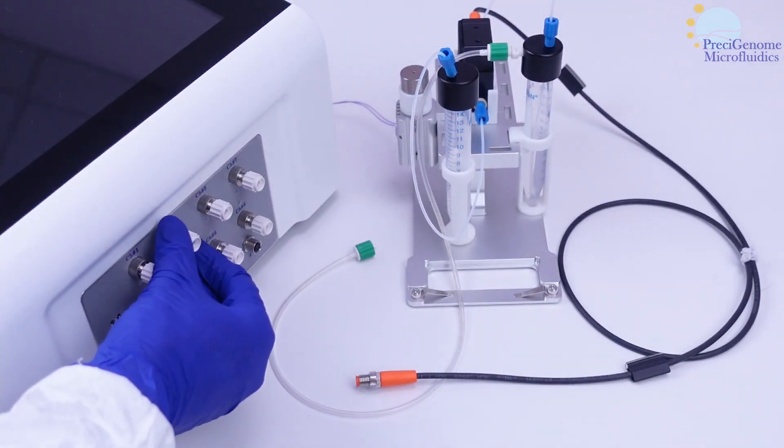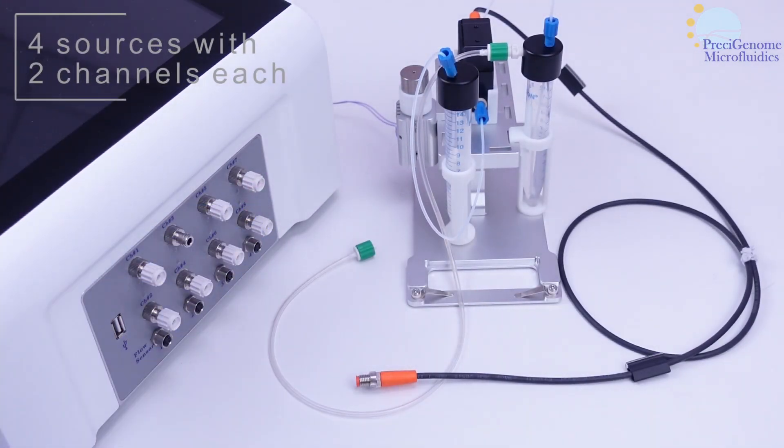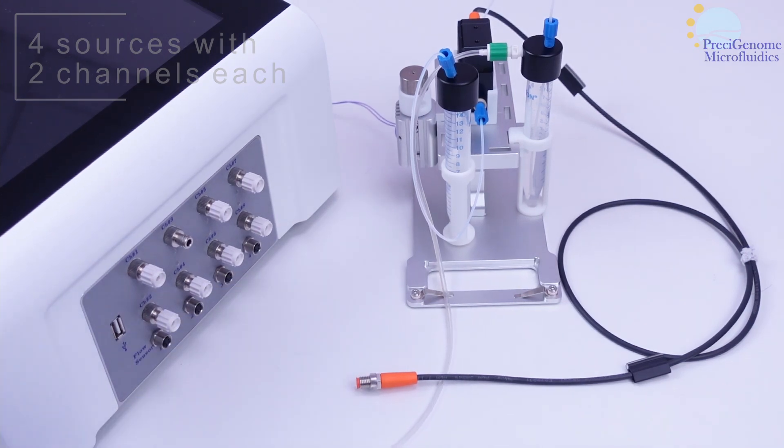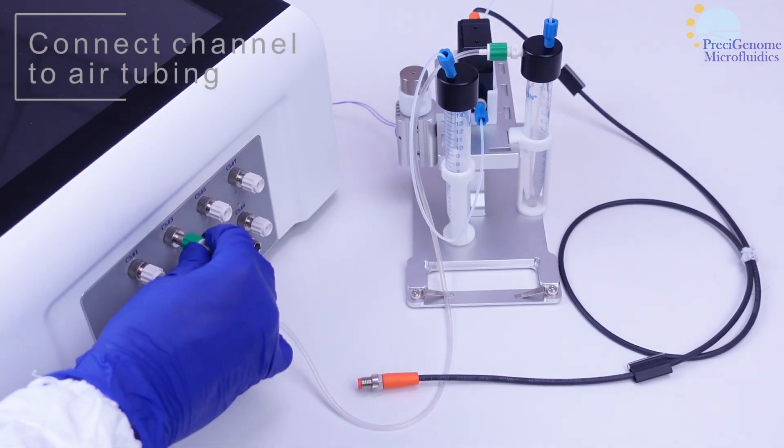The iFlowTouch has four independent sources with two channels each. These connect to other components with Tygon tubing.